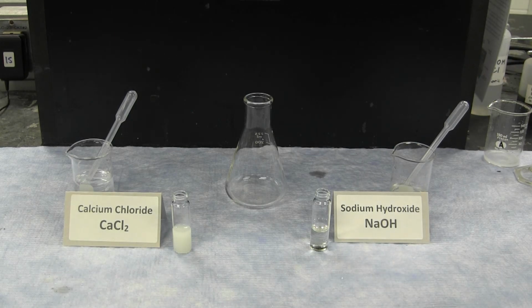Based on these observations, you can determine what is the limiting reactant in this particular setup, as well as, using the concentrations given in your unknown file, you can determine the theoretical yield of the reaction, as well as specifically how much solid was present in the reaction, taking into account the solubility values of the products.